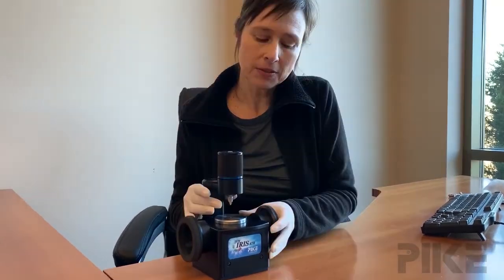Hello everyone! Today we're going to talk about ATR quality performance checks. What I would recommend to put in your SOPs is to check your energy throughput periodically. This procedure is detailed in our manuals, but let me step you through it.